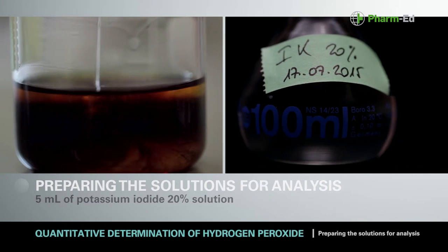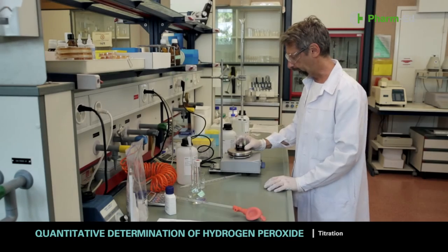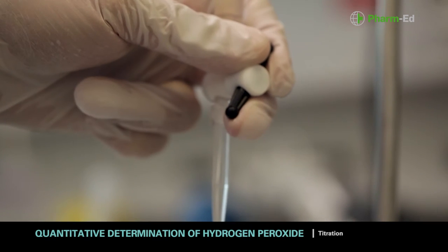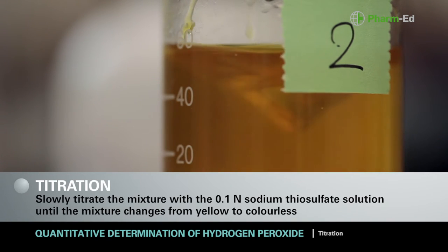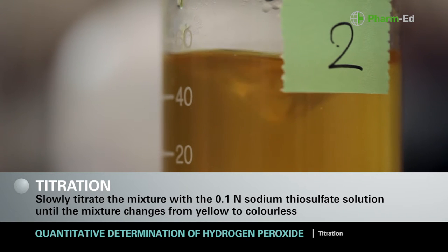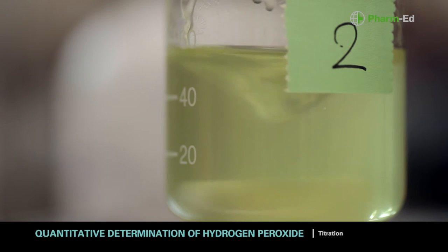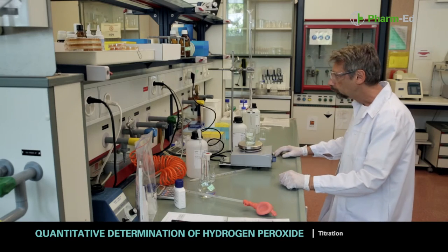Add the magnetic stirrer so that mixing of the solution continues throughout titration. Slowly titrate the mixture with the 0.1N sodium thiosulfate solution until the mixture changes from yellow to colourless. When titration is complete, note down from the burette the number of millilitres needed for the reaction.